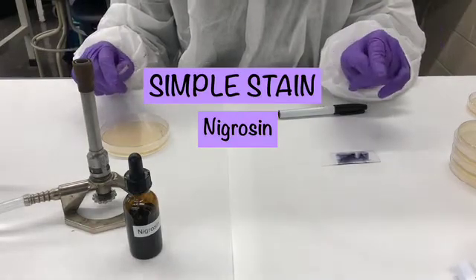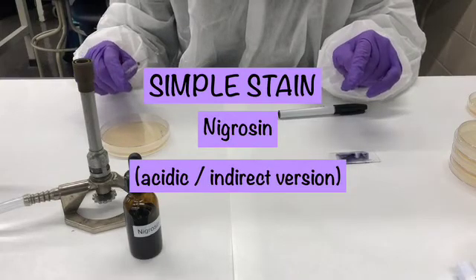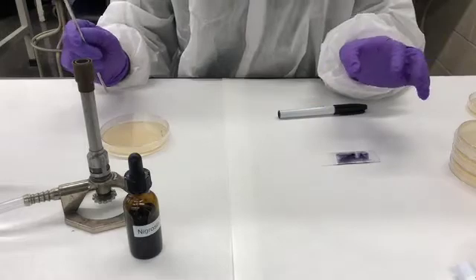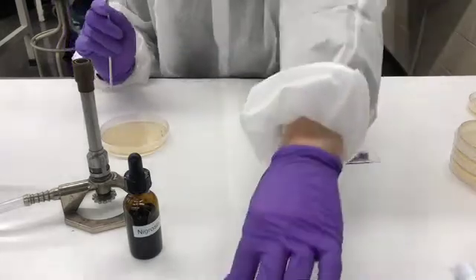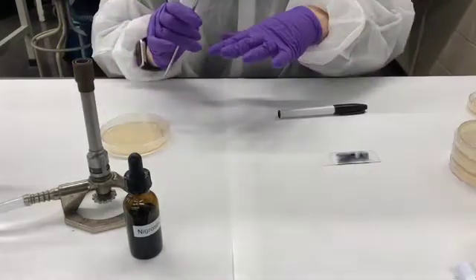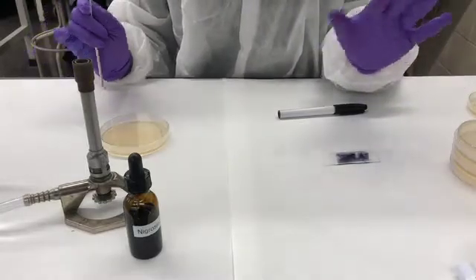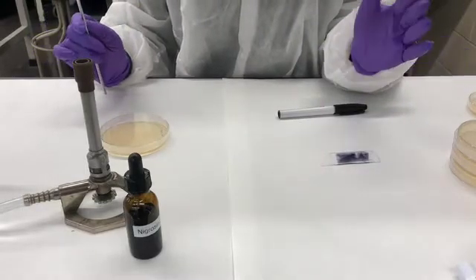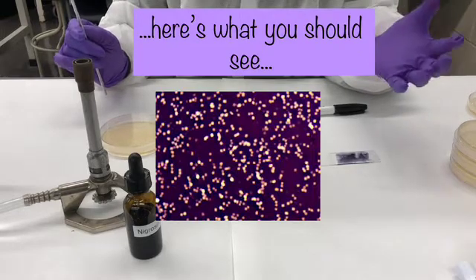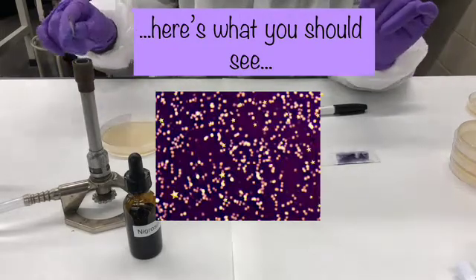Instead, nigrosine is an acidic stain, meaning that it has a negative charge. It's going to be attracted to the positively charged microscope slide and it's going to be excluded by the negatively charged microorganisms. So essentially, you can think of your cells appearing as a kind of a starry night in a darker background.